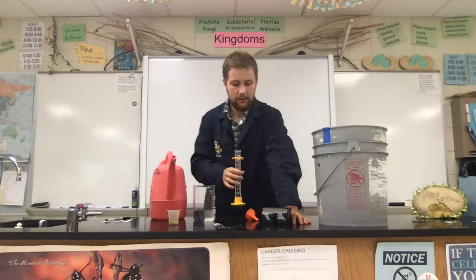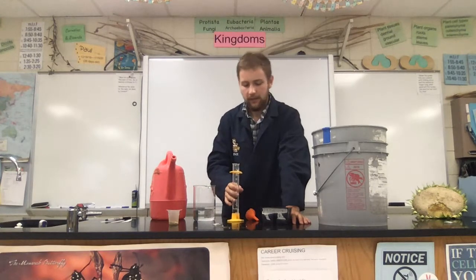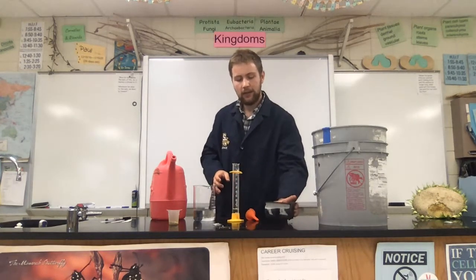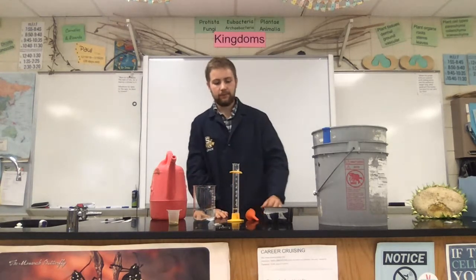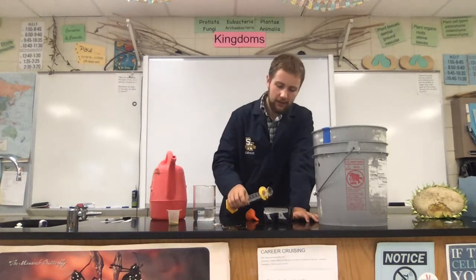All right. We'll wait for that a second as it's pooling on the table. That's all right. Science is messy. Just like ideas are messy.